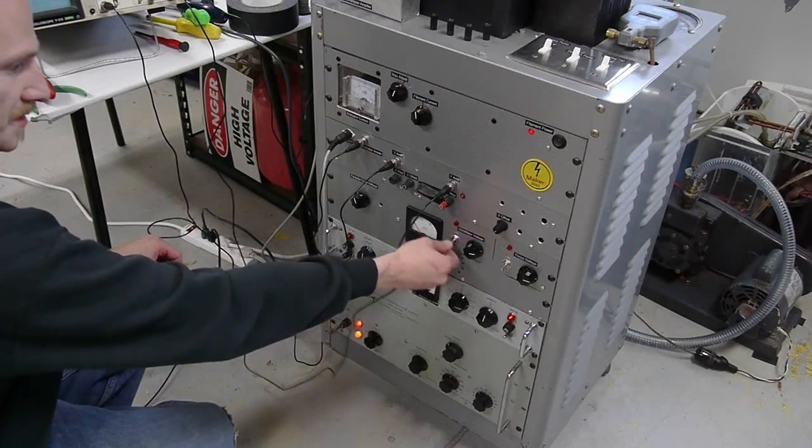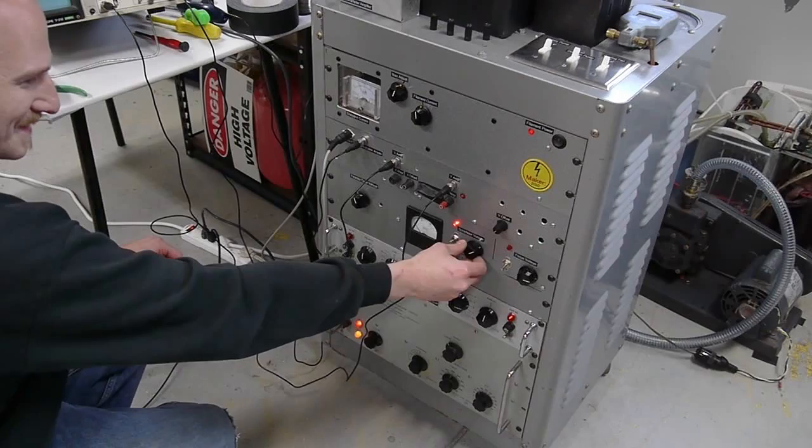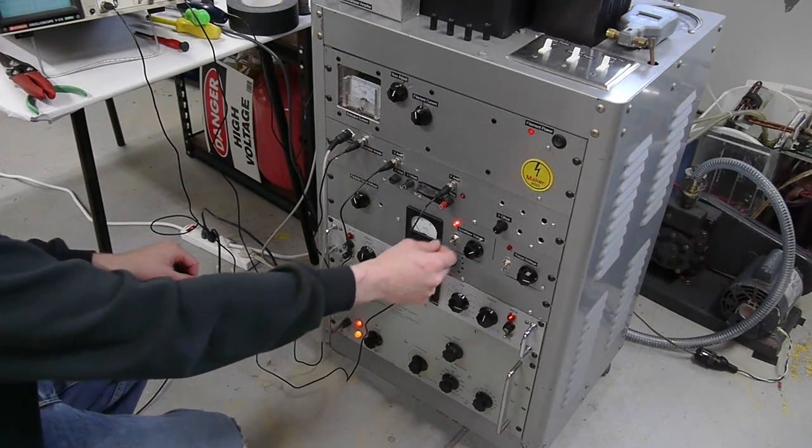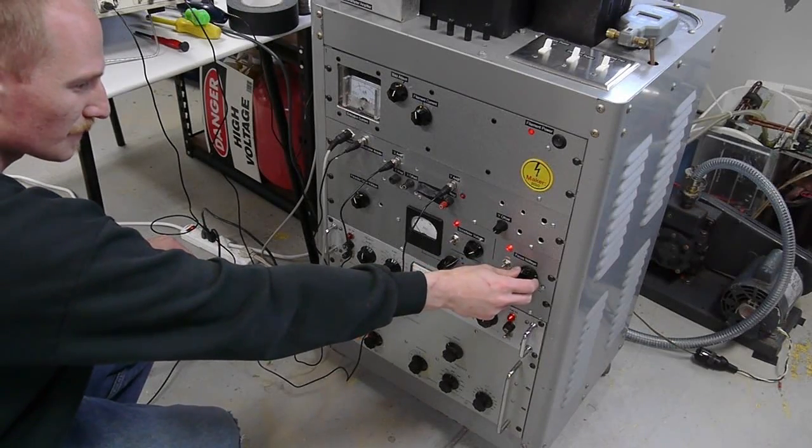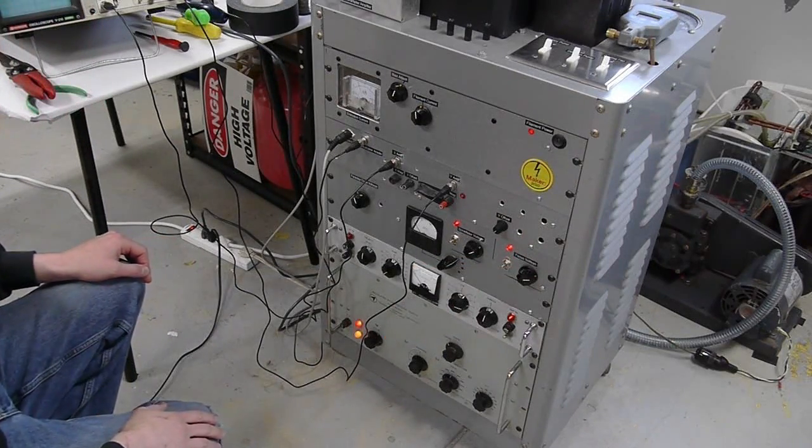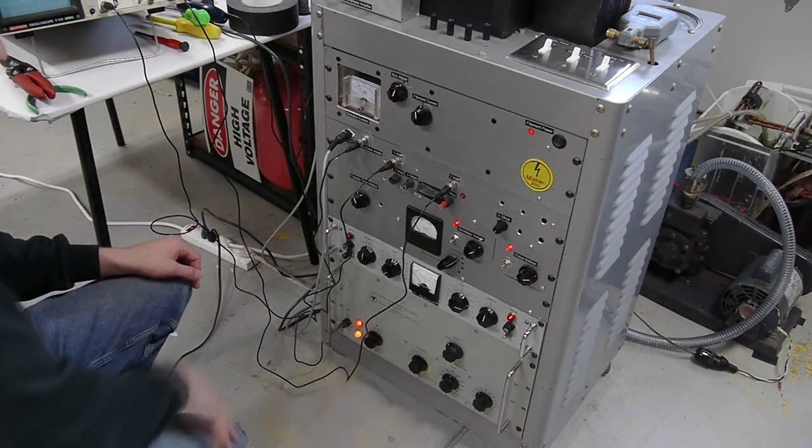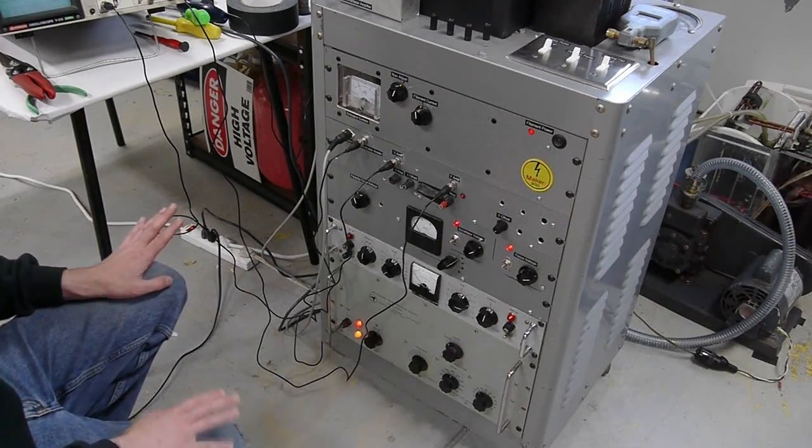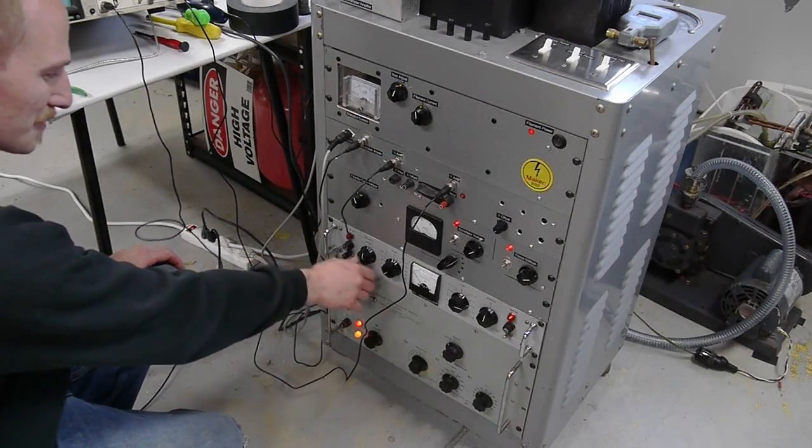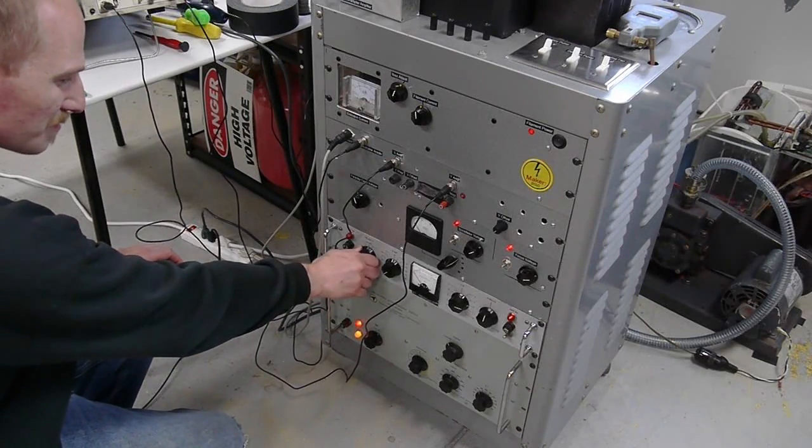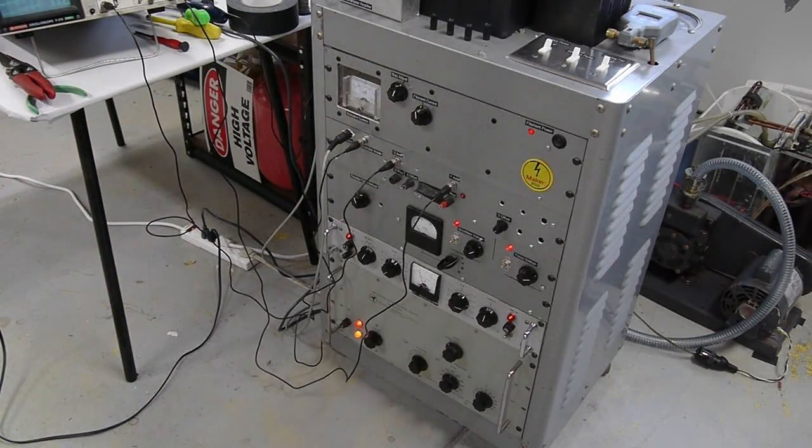In the meantime, I'm going to turn on the scintillator voltage. Little bit of arcing there, always a good sign, and I'm going to turn on the focus voltage. We still have 50 microamps of emission current, which is good. That means that that arcing didn't kill anything. This microscope sometimes arcs. That's just the way it is. I'm going to turn on the photo multiplier supply voltage and we now have an image on the oscilloscope. So let me turn off the room lights.